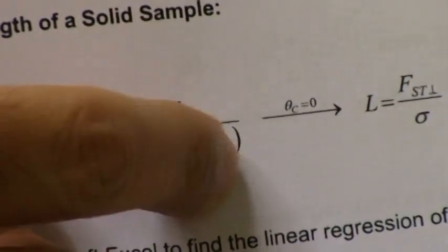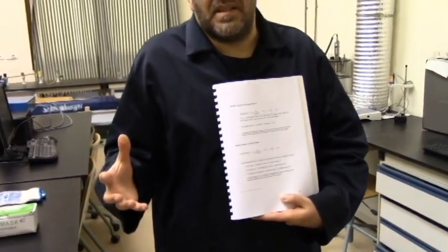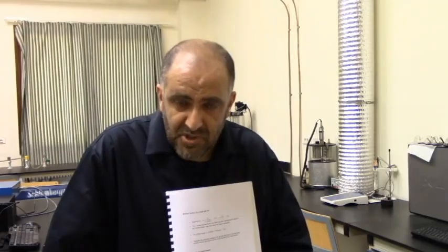So I need to get rid of this sigma cos theta once again. So I need once again a perfect wettability as much as possible. So for a given solid, what do you expect a liquid to be used? Should it have a very high surface tension or very low surface tension? Actually, since I'm after good wettability, then it should be very low surface tension.